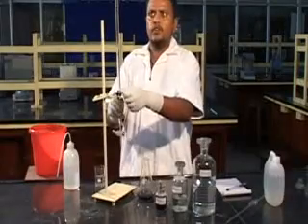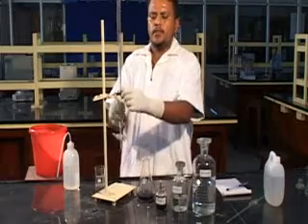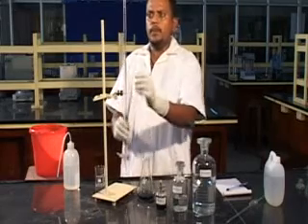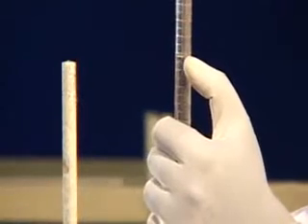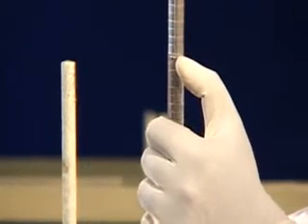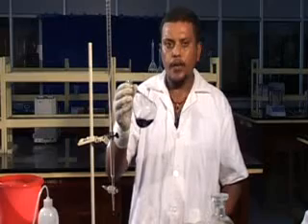Then we are going to note down the reading in the burette. Remove the burette, keep it in your eye level, then note down the reading. Now the reading is 6.2 ml. Once you got the endpoint, that is blue color, repeat the titration for concordant values.